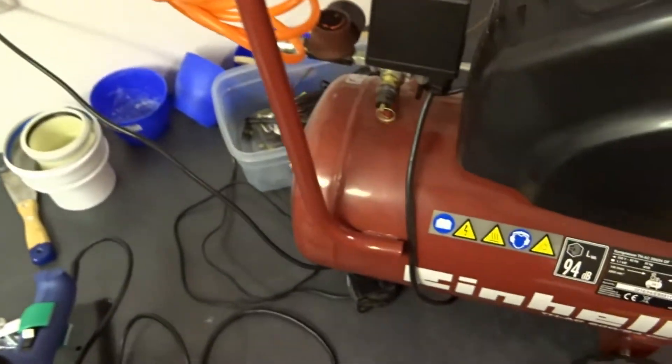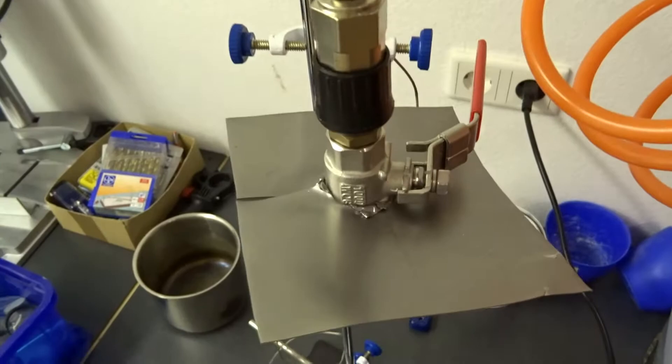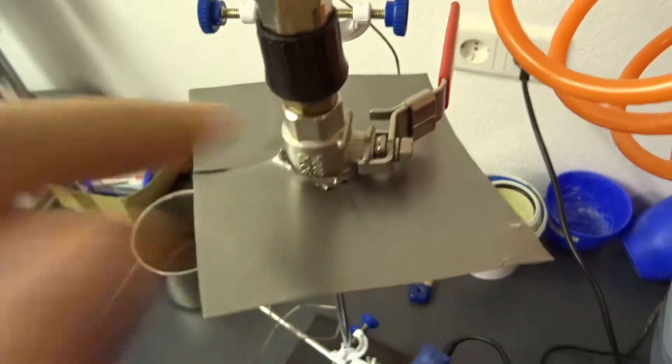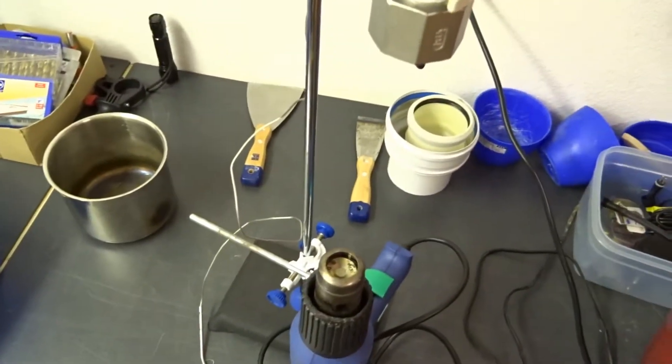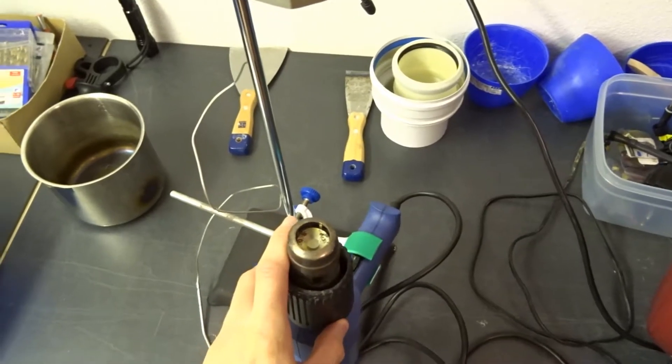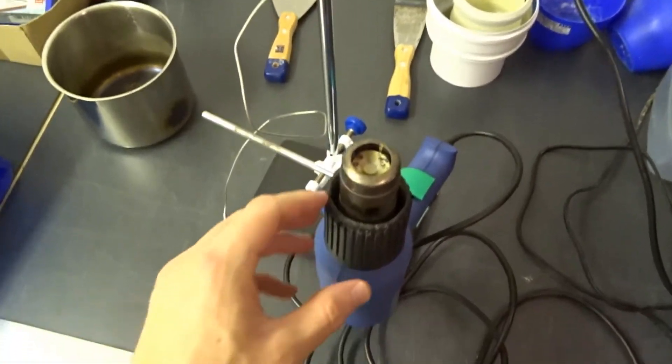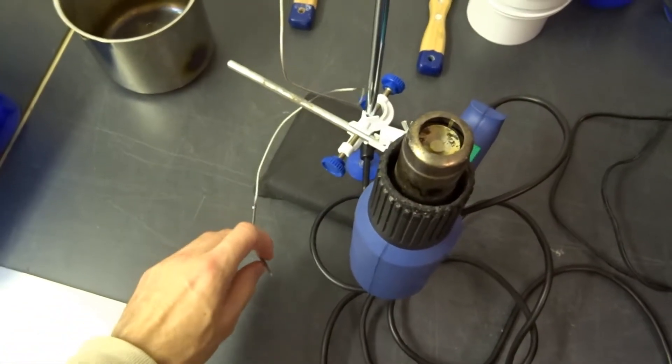Here I have a pressurized hose connecting to this 8 bar compressor with a valve. So I'm going to pressurize the whole chamber and then I'm going to heat it from below using this hot air fan. I also have a thermometer to monitor temperature.